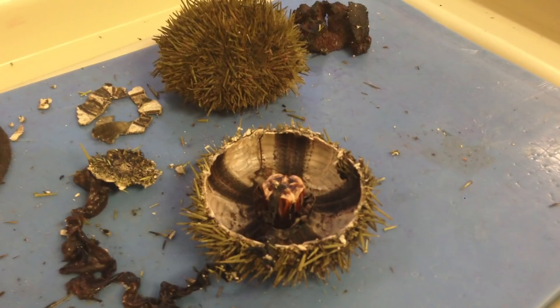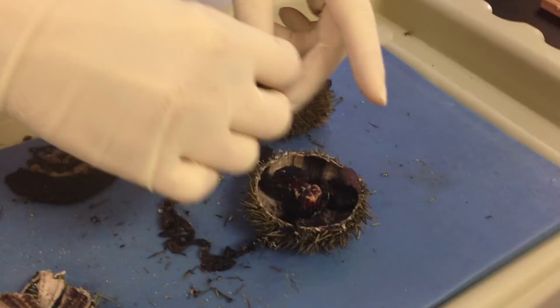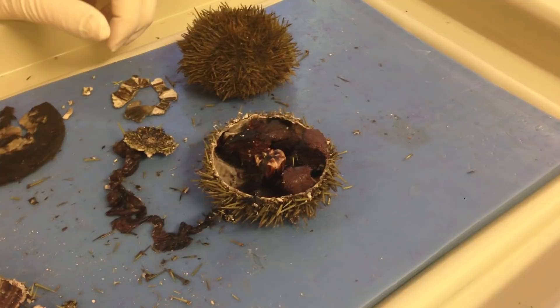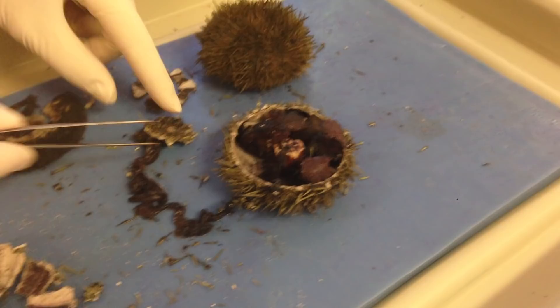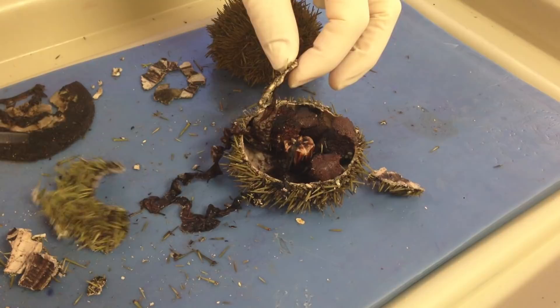When you are done opening this up, inside you're going to find a whole bunch of these structures all lined inside. Those are the gonads — there's going to be a whole bunch of gonads. You want to be very, very careful. What you're going to do is peel off this top piece and then carefully peel around so that you pull off these particular structures, leaving everything else intact.